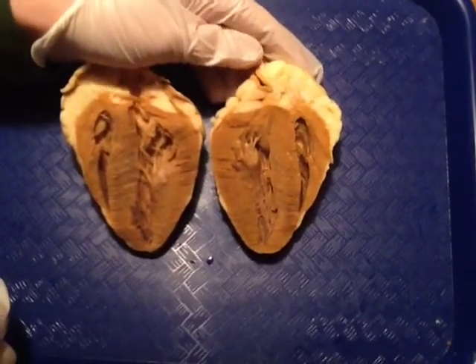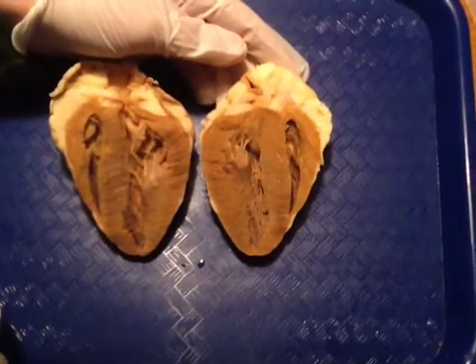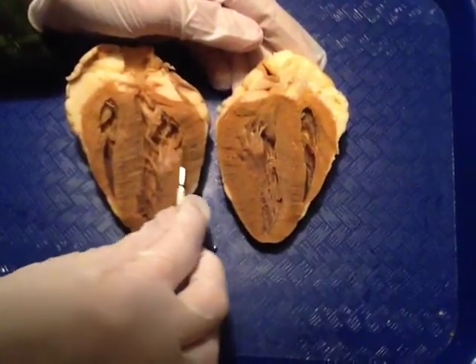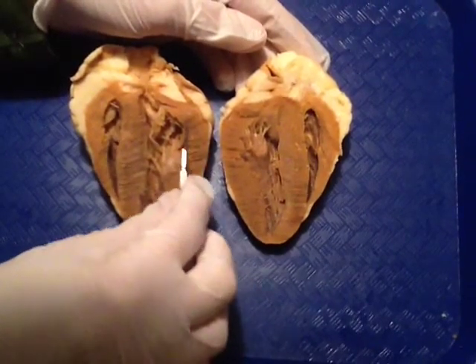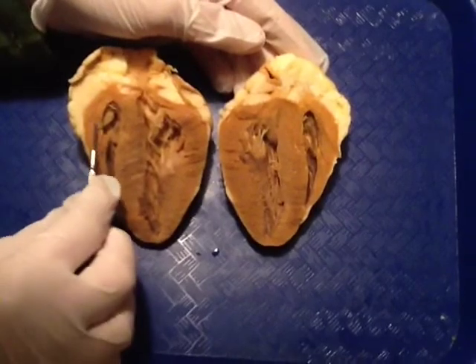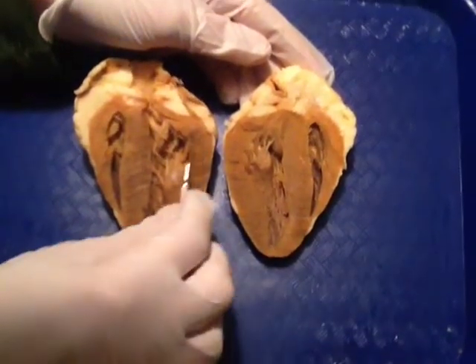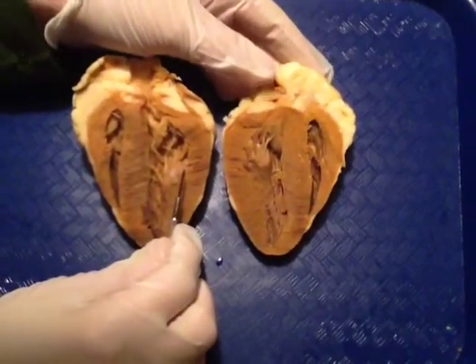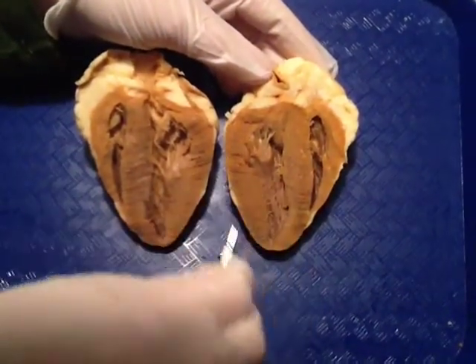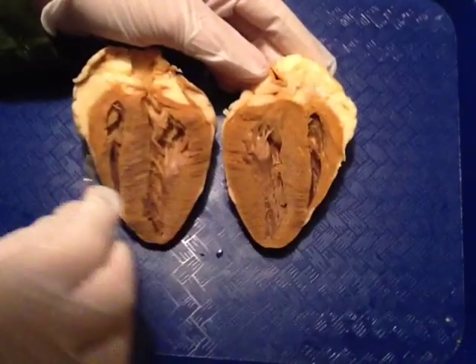When looking inside the heart, you can always determine the right side from the left side based on the thickness. If you look right here, notice you have a very thick wall between this side of the heart and the edge. Over here, you have a very thin wall. The thick side is always the left side of the heart. So here we are looking at the left side of the heart, and here we are looking at the right side.